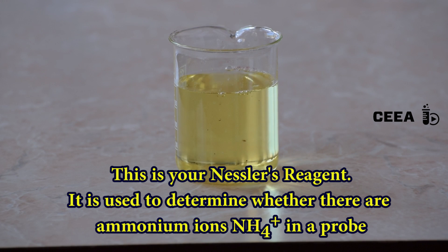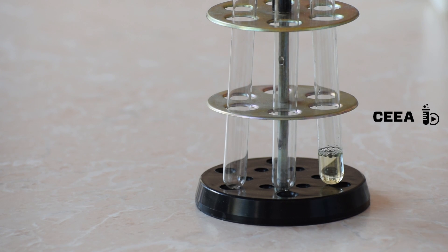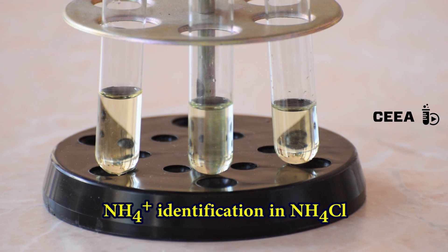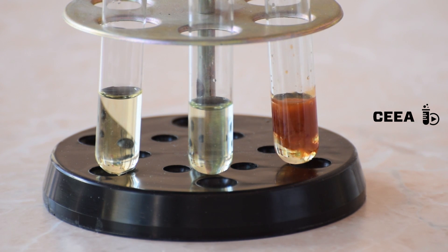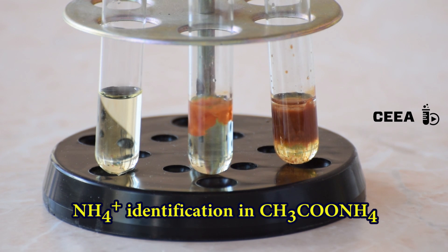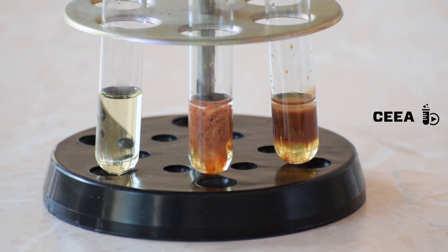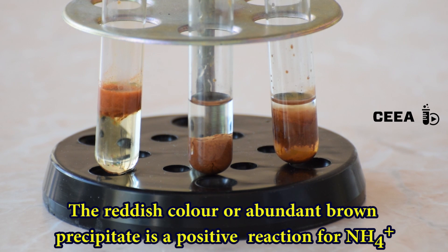Now we use this solution to mark the presence of ammonium ions in different solutions. For this we prepare three test tubes with the Nessler's reagent. We add to the first test tube a solution of ammonium chloride and notice a brown-orange precipitate. Ammonium acetate gives the same response when mixed with the Nessler's reagent. Ammonia, which contains ammonium hydroxide, also gives a positive reaction.